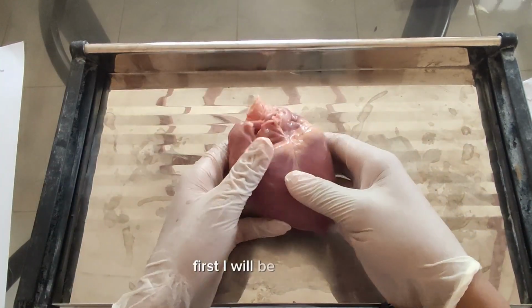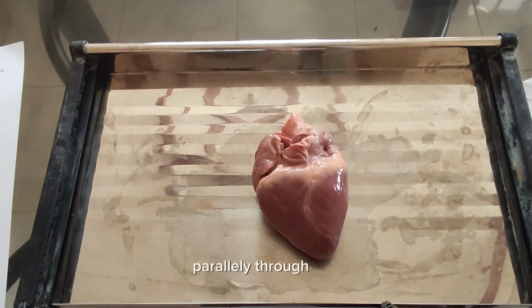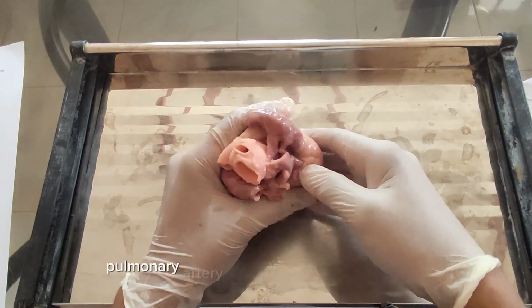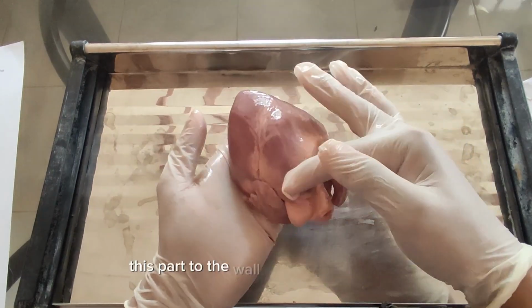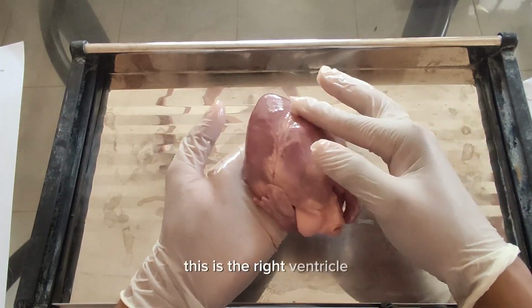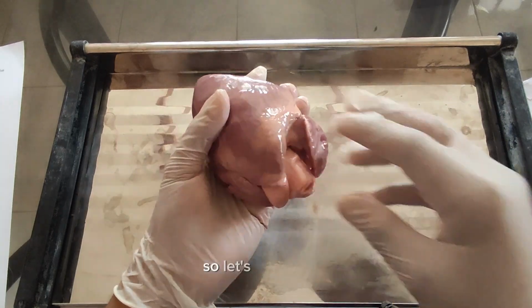First, we will be cutting parallel to the pulmonary artery, just onto the side of it. Then continue cutting down into the wall, to the right ventricle. And this is the right ventricle. Just be careful not to cut it too deep, so let's get on to it.